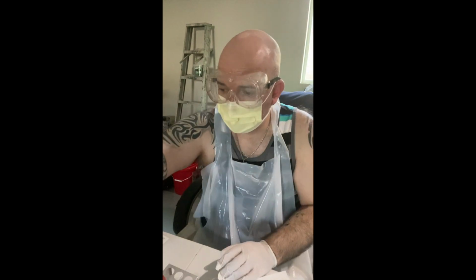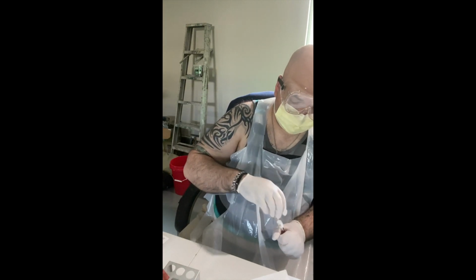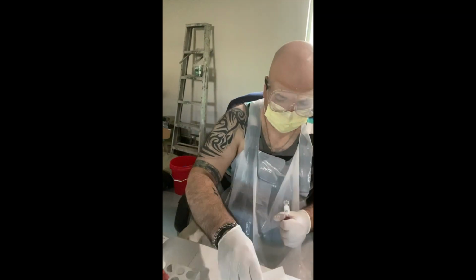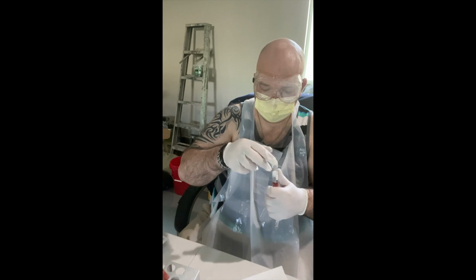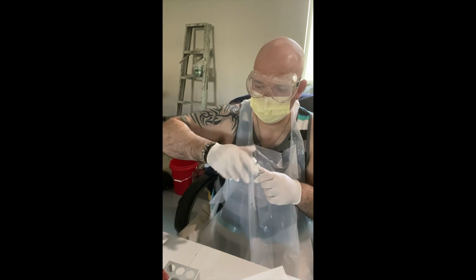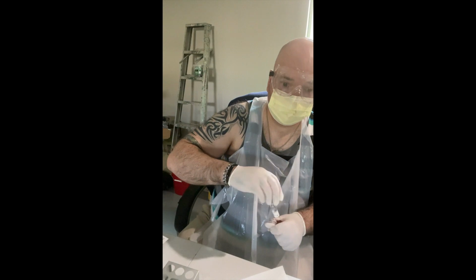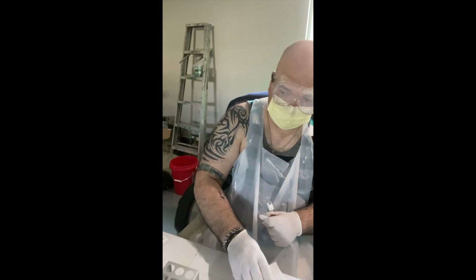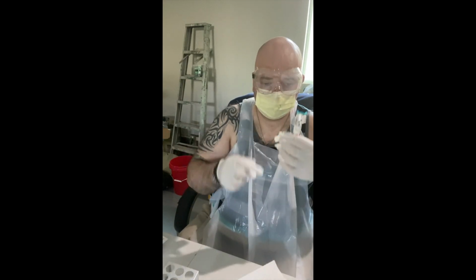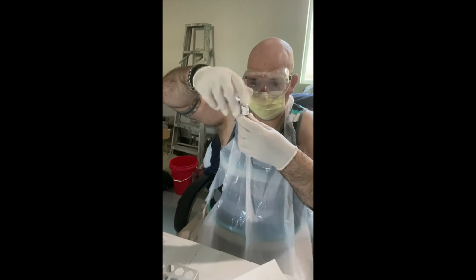Okay. 4. Hopefully you can see this on camera.